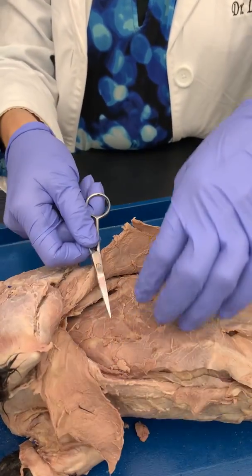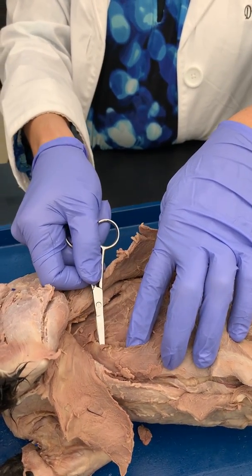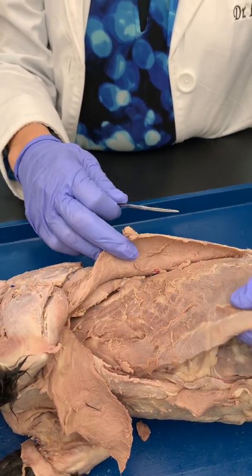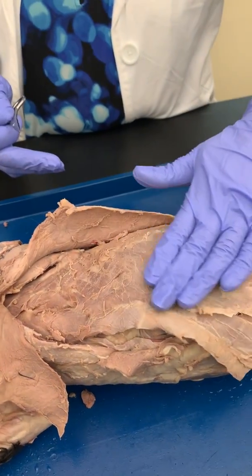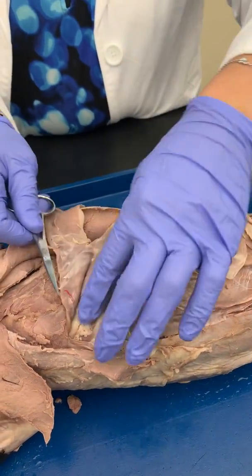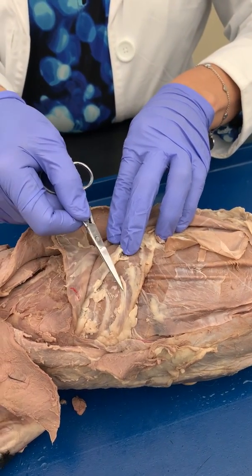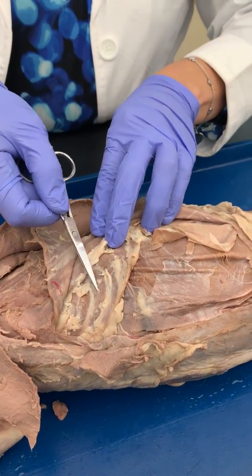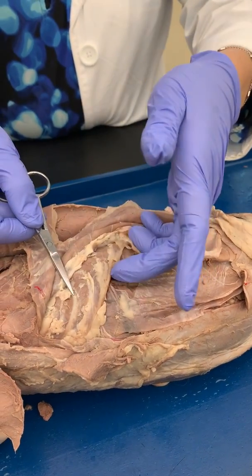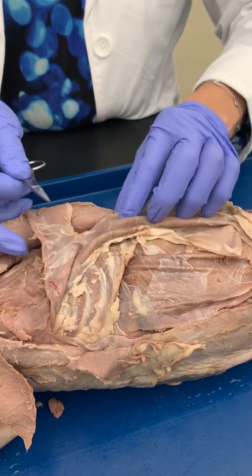Deep to the pectoralis muscles, you have this muscle that runs lengthwise in the chest. This is your scalenus, okay? Then if we go a little bit deeper, here is your external obliques. We can cut that back. If you clear away some of the fat and connective tissue, you can see the ribs. In between the ribs, that's where you have your intercostals. So you have both external, which is on the outside, and internal intercostal. You just need to know the external intercostal.